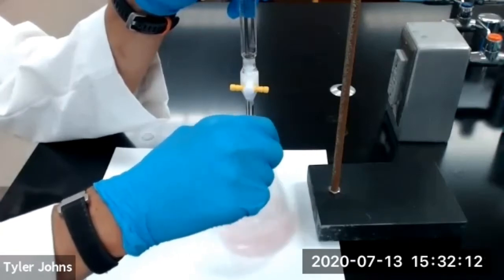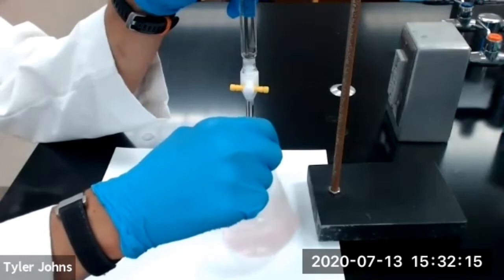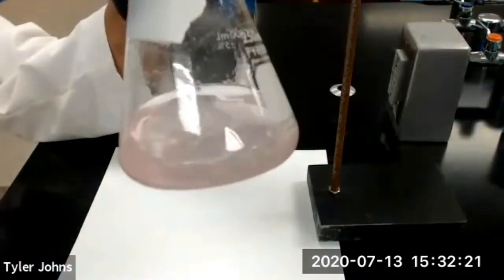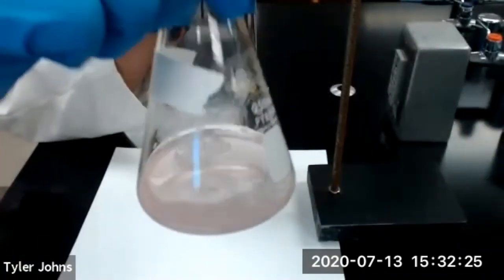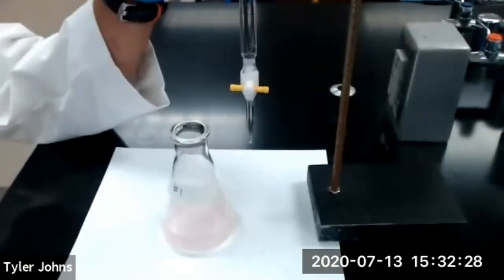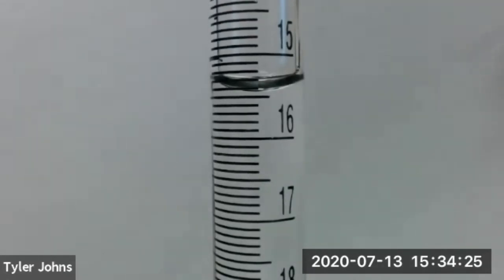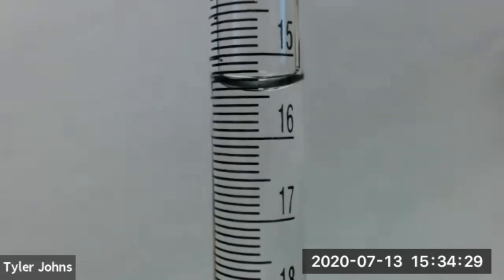We now have a pink color that has persisted with swirling for at least 30 seconds, so we have reached the end point of titration number one for the first half of our vitamin C tablet. This is our final burette reading for the titration of the first half of our vitamin C tablet, or titration number one.